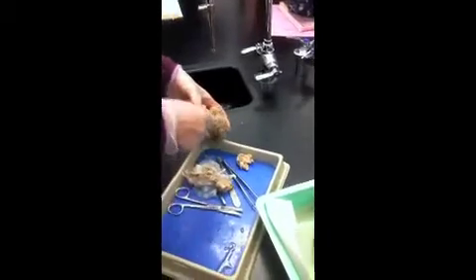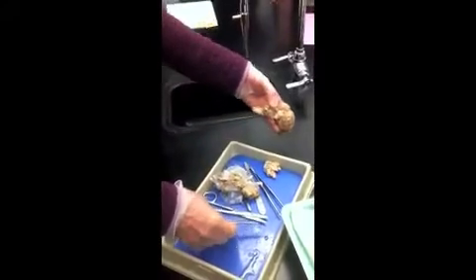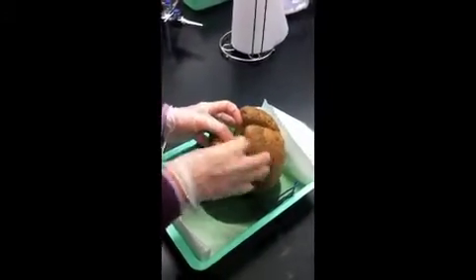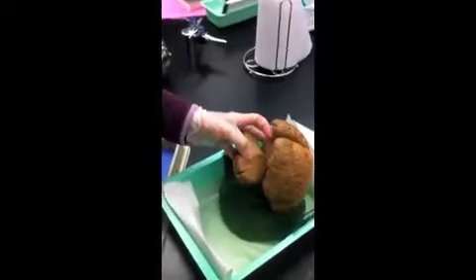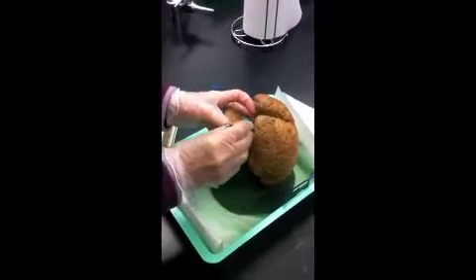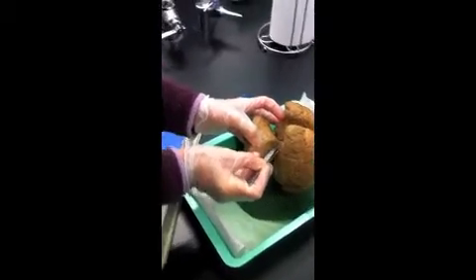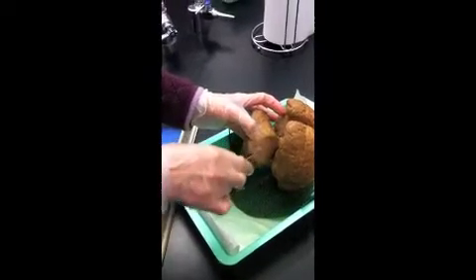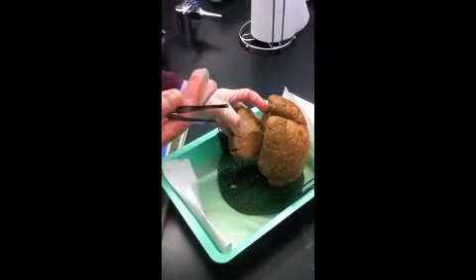Let's compare. Notice their superior colliculi for visual reflexes are quite large. You can all look at the human also, but you're going to have to get closer than what I can show you. And he's getting kind of mushy. This little piece just came off. We don't see as large superior colliculi as we do on the sheep. Their visual reflexes are so important for survival.